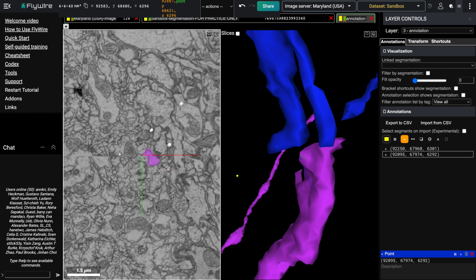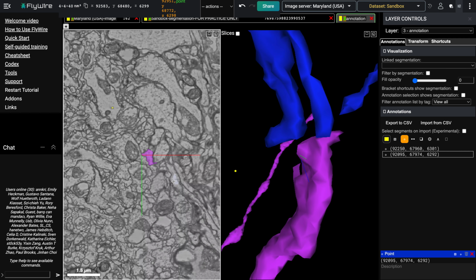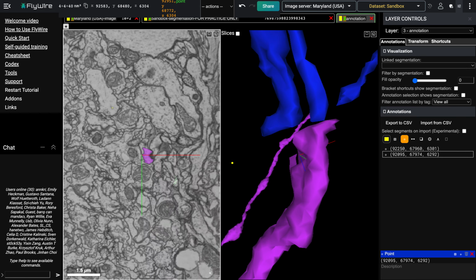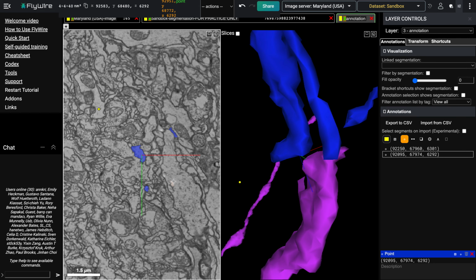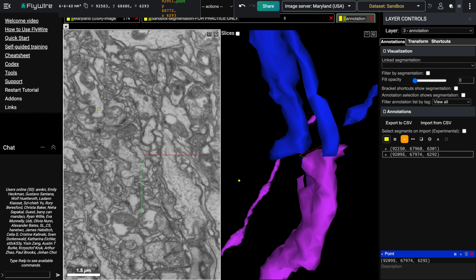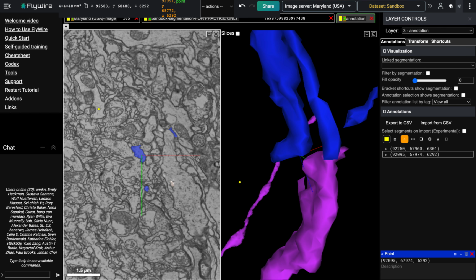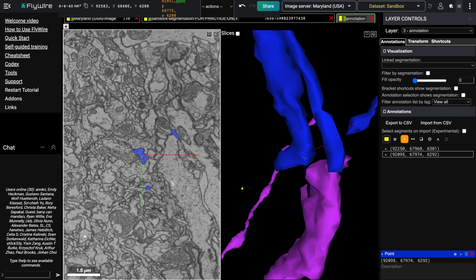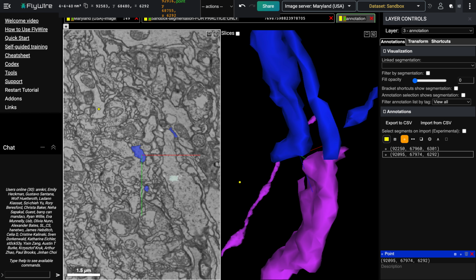And then you want to go back to the EM and make sure. So I'm going to scroll between them quickly, and you can see where there's a jump, but now that we've selected both of them, I think it's fairly easy to see that it does look like a good continuation of this branch.